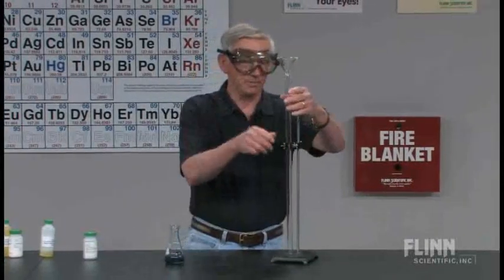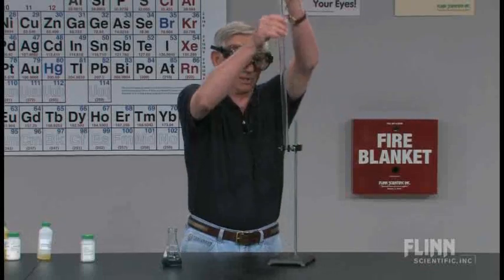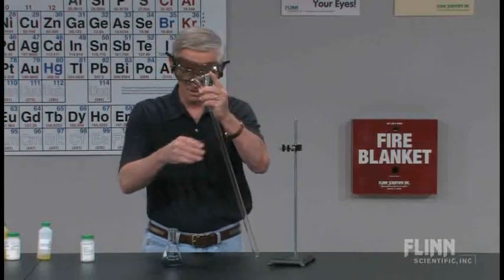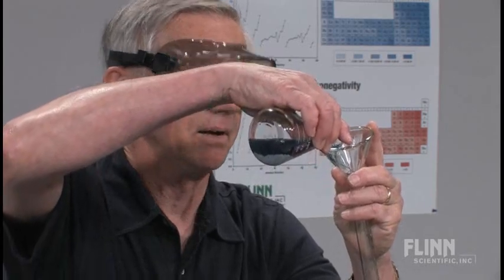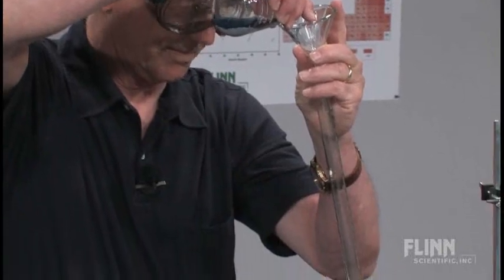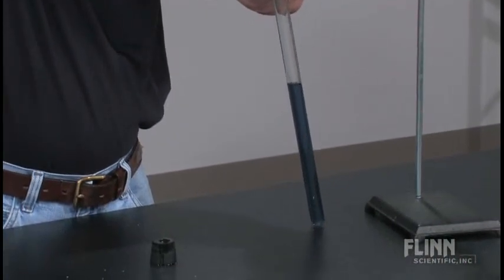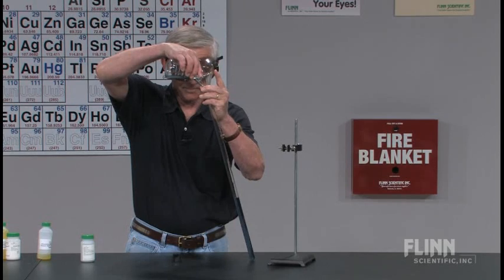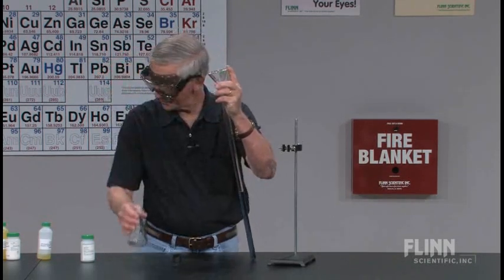I'm going to take the tube out for a minute. I promise to put it right back where I found it. So there's the vanadium 2.